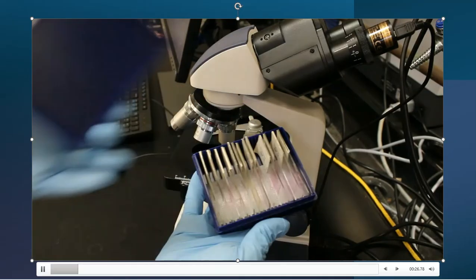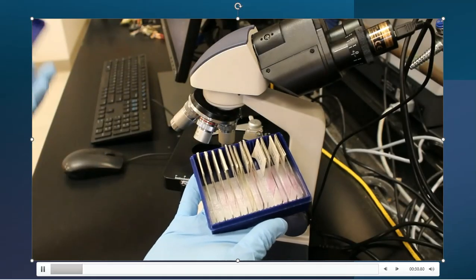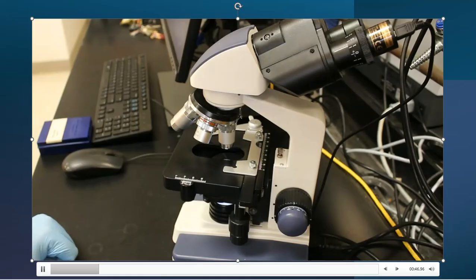And inside of the box, you're going to have all of these slides that are numbered and labeled, and we're going to have to analyze them to see if they are maybe blood samples from a human suspect or a victim. Because this is forensics, right? Again, it's not biology, but we've got to put a forensic spin on it in some form or fashion.